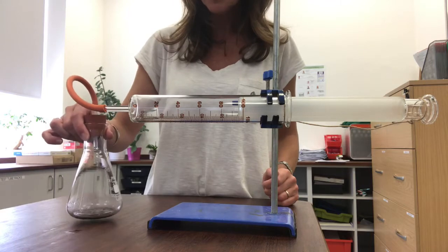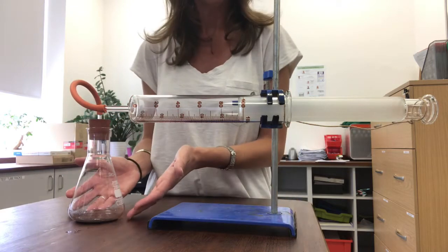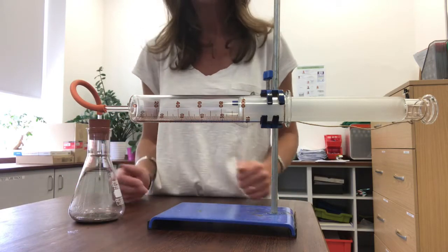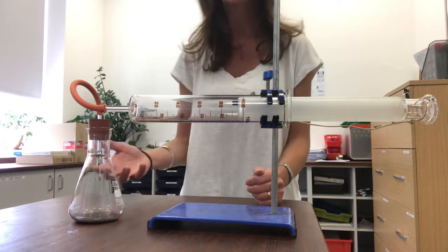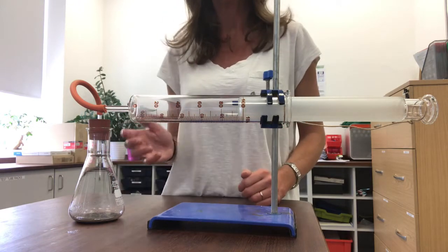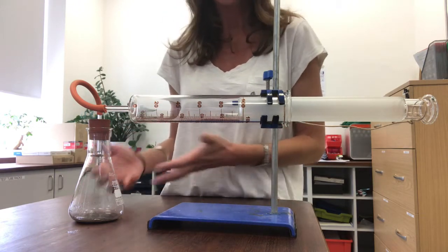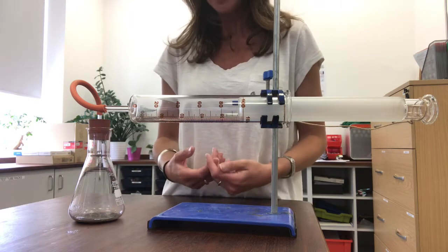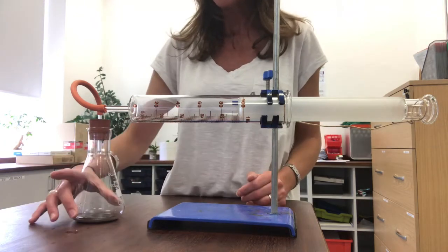I'm going to leave this for a week so that the iron can rust and I've put plenty of iron in there so it's got an opportunity to react with all of the oxygen that's in this whole system. It's not going to run out of iron before the oxygen is used up. So I made sure there's lots of iron in there.